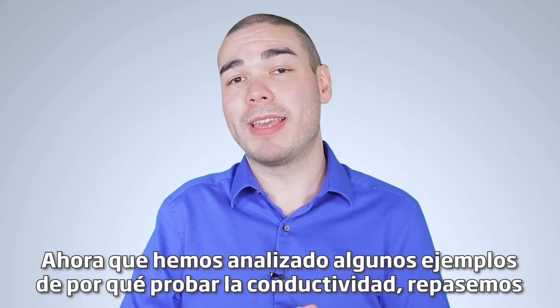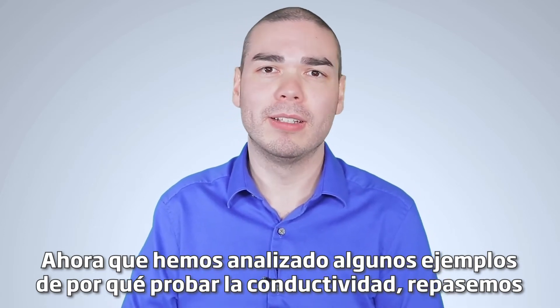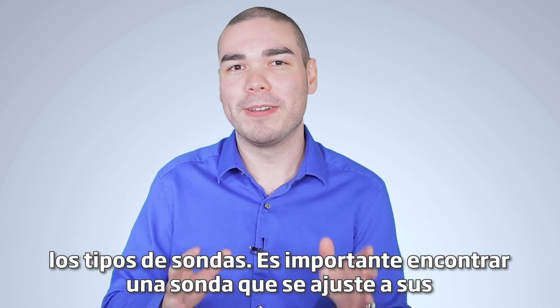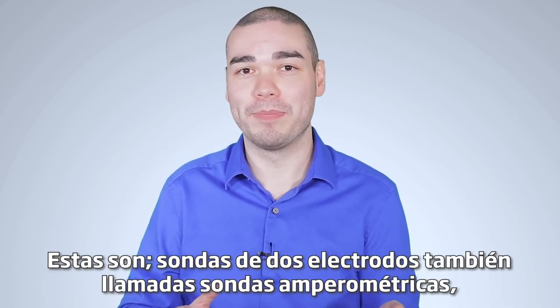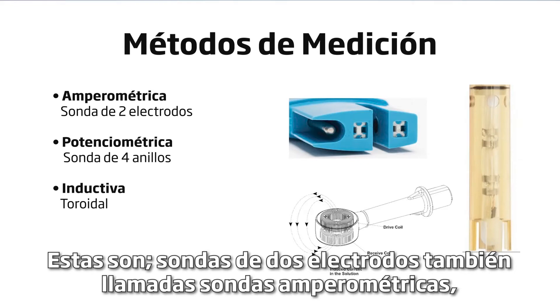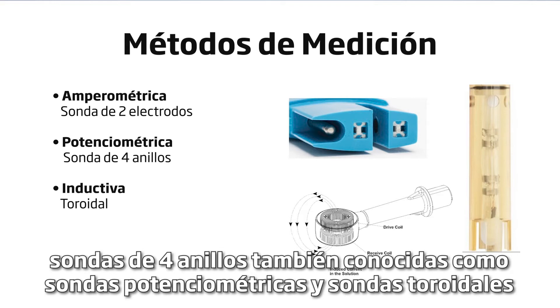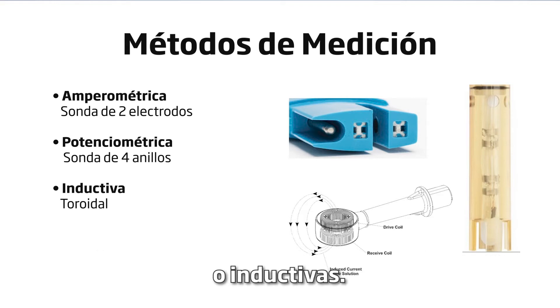Now that we've gone through some examples of why you would test conductivity, let's go over the types of probes. It's important to find a probe that fits your testing needs. There are three types of probes we'll cover: two electrode probes, also called amperometric probes; four-ring probes, also known as potentiometric probes; and toroidal or inductive probes.